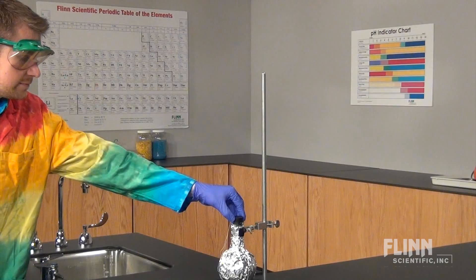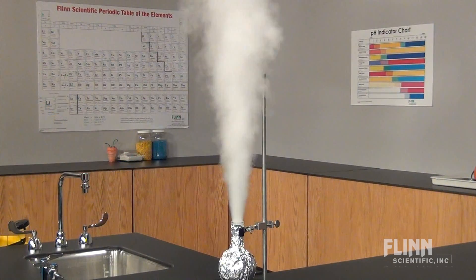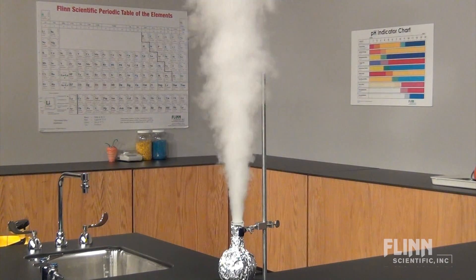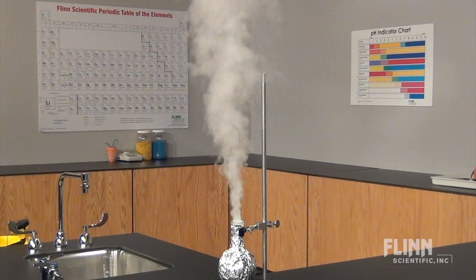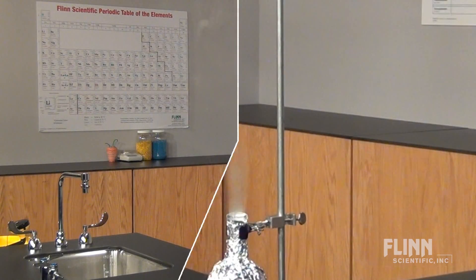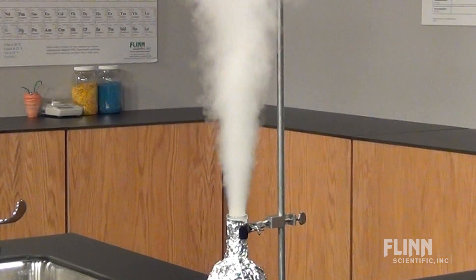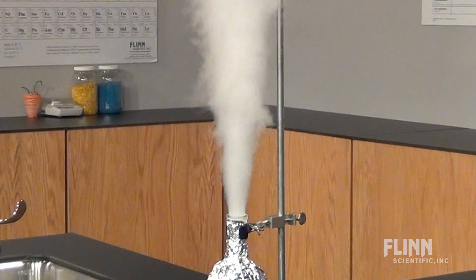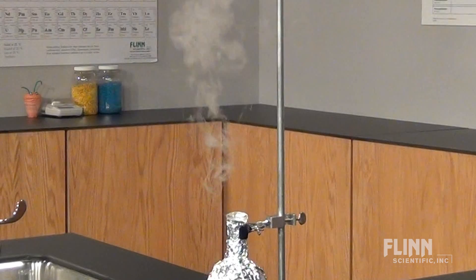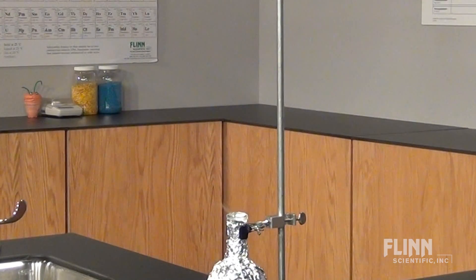Conjure the spirit of chemistry in your classroom when the stopper is removed from a bottle. A hydrogen peroxide solution undergoes catalytic decomposition, producing water vapor and oxygen gas. This is a great demo to use when discussing catalysis or types of reactions.